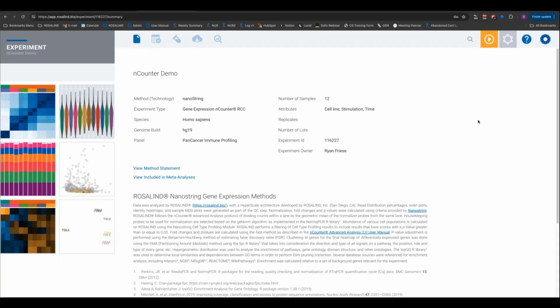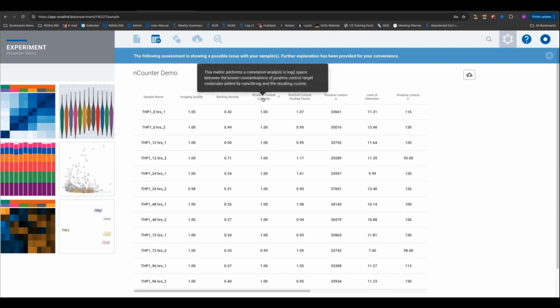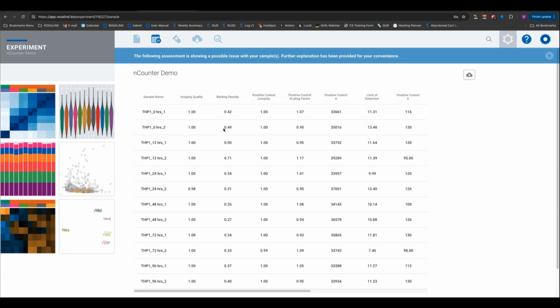Let's see, one more question. So I know you said that we would have the decision tree soon, but I guess the question is, how do I establish what are good thresholds for some of these metrics? Yeah, so the thresholds, 2 things. If these metrics did exceed a threshold, it would be flagged directly in the Rosalind platform. So you'll see it here visually.